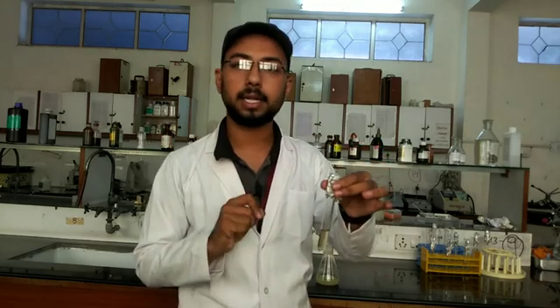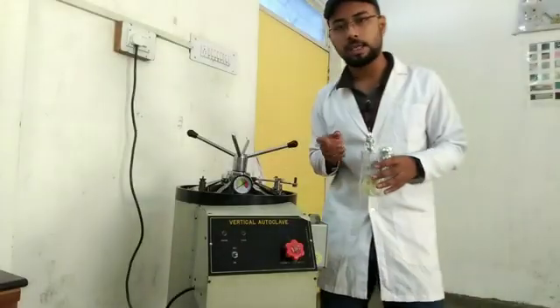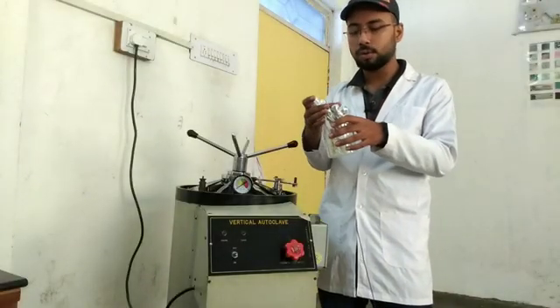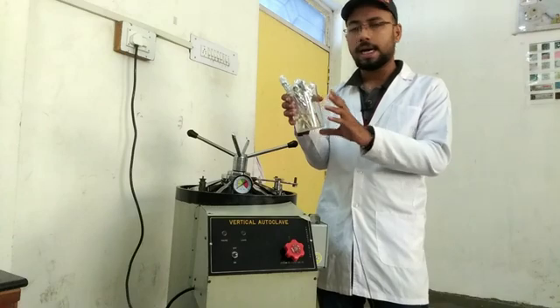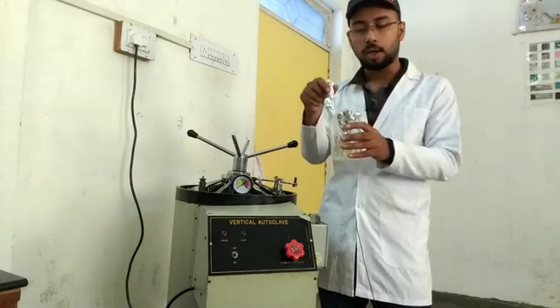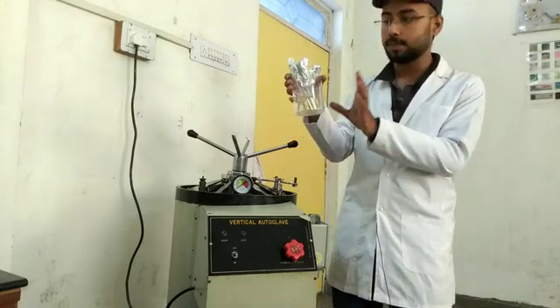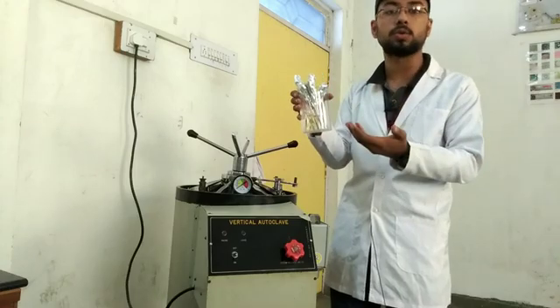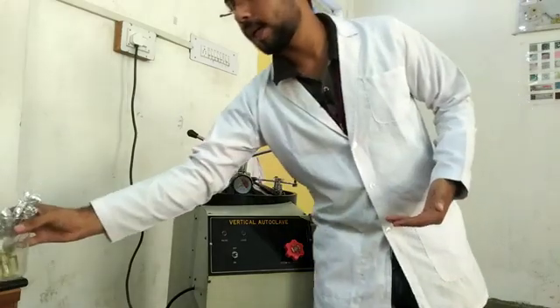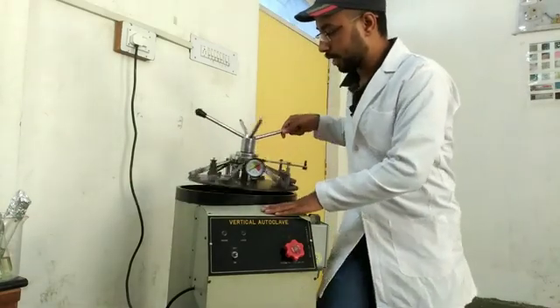The prepared nutrient broth is not yet suitable for bacterial culture because sterilization has not been done. We need to sterilize it. Place the test tubes in a large beaker, ensuring all are covered with foil and cotton plugs, and prepare them for autoclaving.